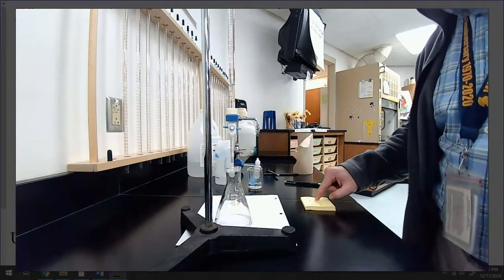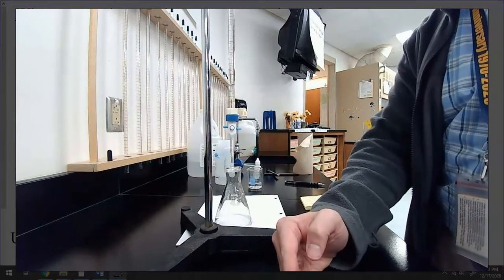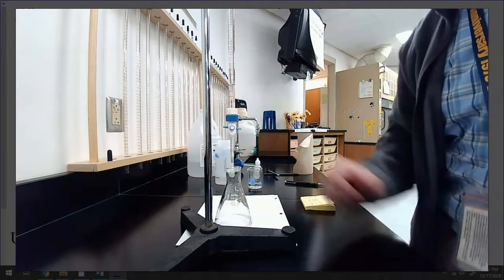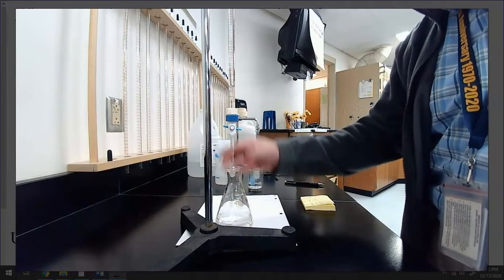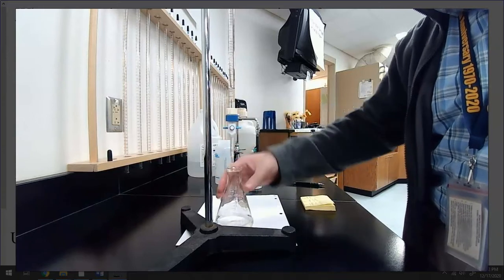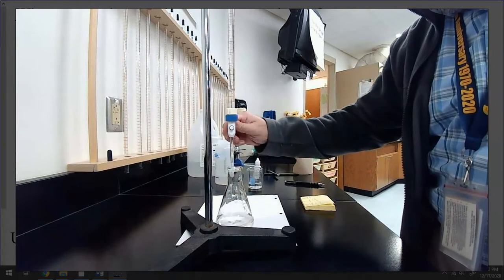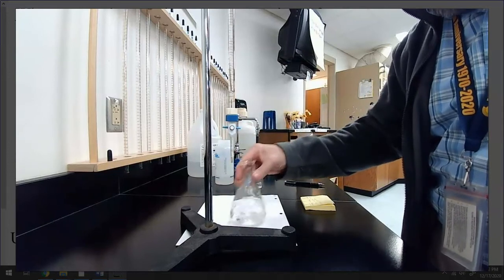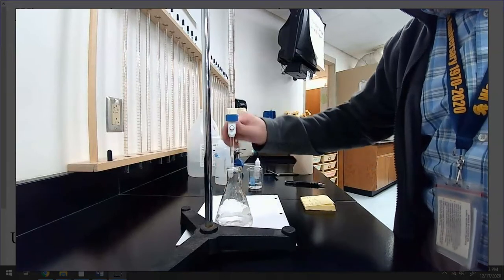And then I would do the same thing. So I'd have like 2 pieces that I would need to add. I would have a start and a stop from the first time, and then I would have a start and a stop from the second time, and I'd just add those together to get my total volume. That's perfectly fine. Not necessarily ideal, but we'll see if we can avoid it. I think we can avoid it. Yeah, we're going to avoid it. I think. I think we're okay.